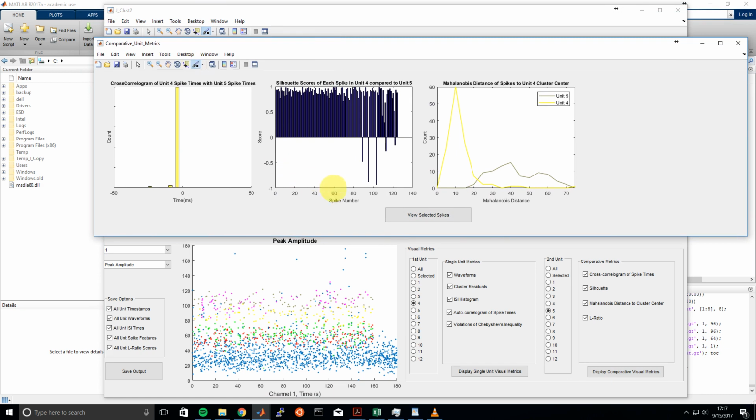And so what we can do here is start by looking at the silhouette scores of each spike in Unit 4 compared to Unit 5. Essentially every bar in this bar graph represents a spike. For all those negative values here, it's saying that those spikes that were originally assigned to Unit 4 are actually closer to the cluster center of Unit 5 in Mahalanobis distance space, in a four-dimensional space. And those four dimensions are the feature we're currently looking at, which is the concatenated waveform PC score space.